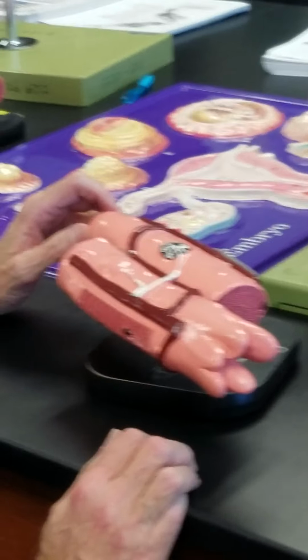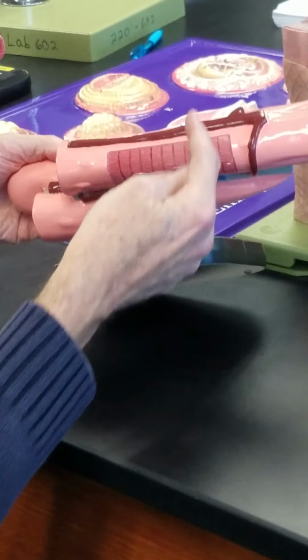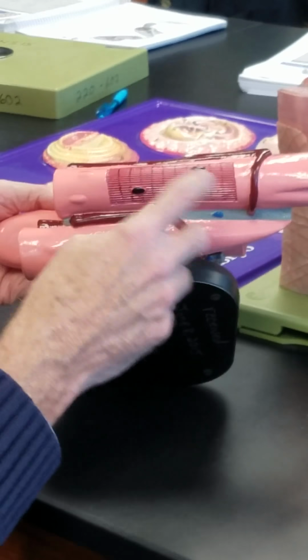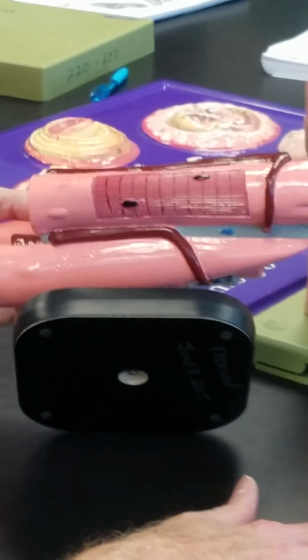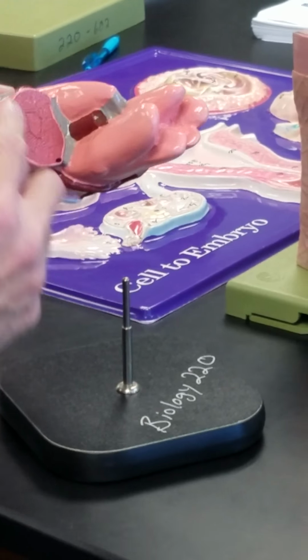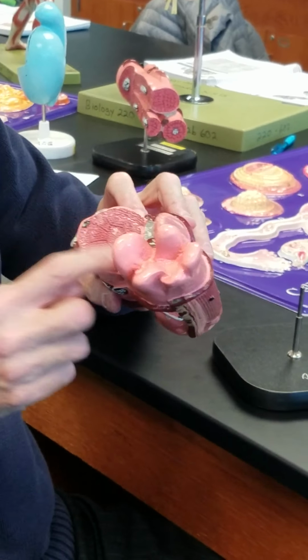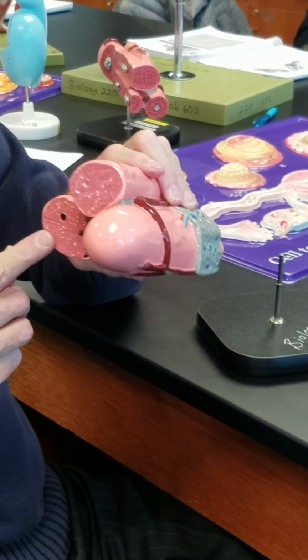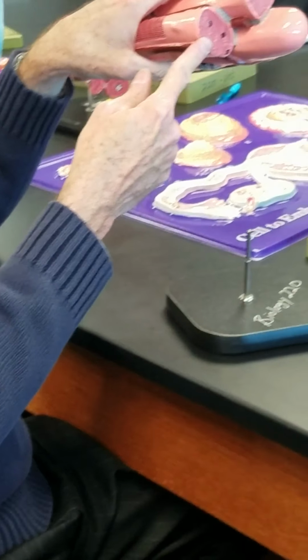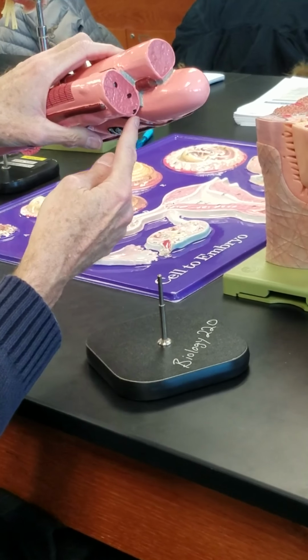Skeletal myofibers here. And so sarcolemma and striations, multiple nuclei. So striations and multiple nuclei, guaranteed, hands down, skeletal muscle cell. And the cross-sectional view reveals that the nuclei are very, very shallow. They're just under the sarcolemma. So what's wrong with that view? That one's okay. I've got no problem with that nucleus here on the edge.